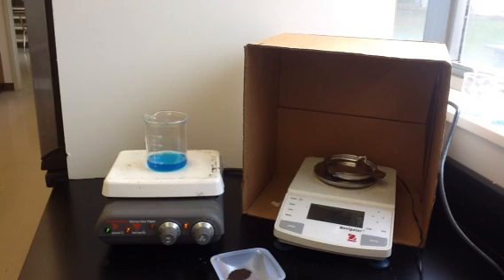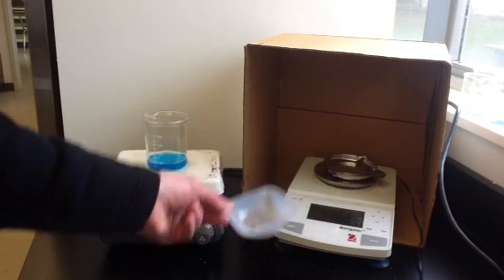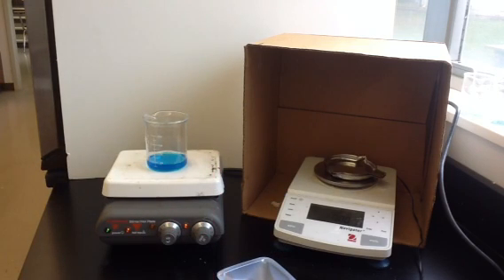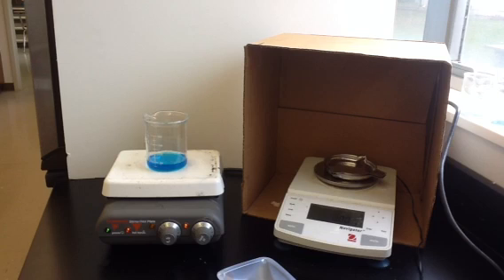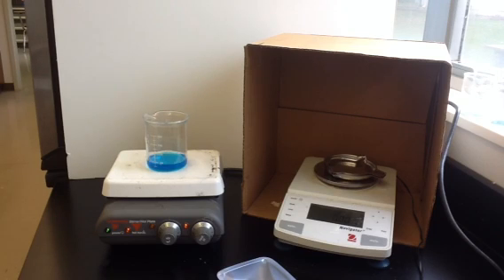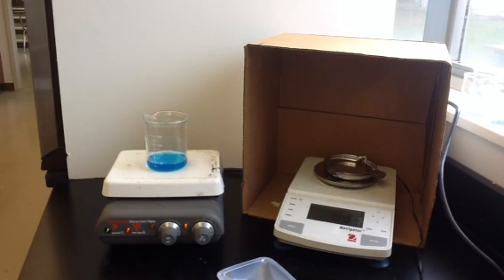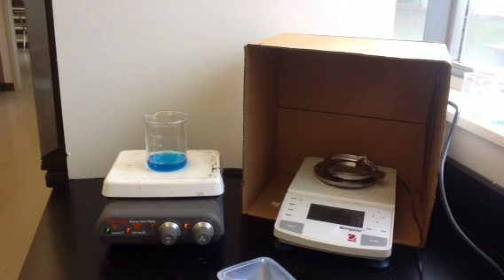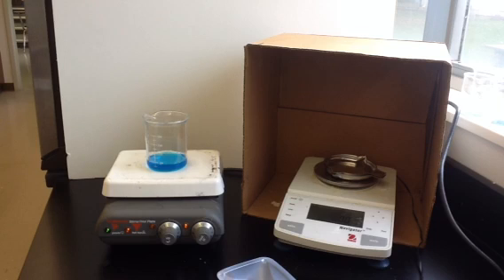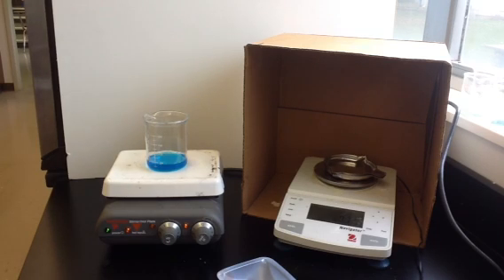You need to do some stoichiometry calculations. We're starting out with 1.00 grams of iron. Do the calculation assuming it's going to produce iron 2 sulfate and see how many grams of copper should be produced. Then separately, do the calculation assuming it's going to produce iron 3 sulfate. You'll see that it produces a different amount of copper if you're producing iron 3 versus iron 2.